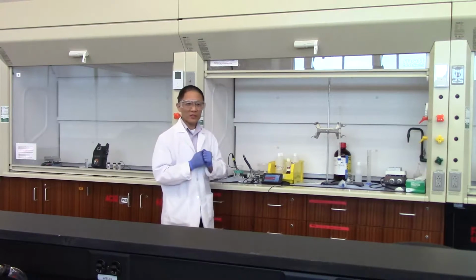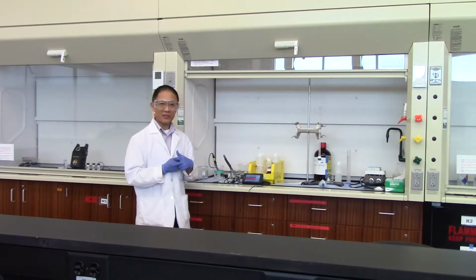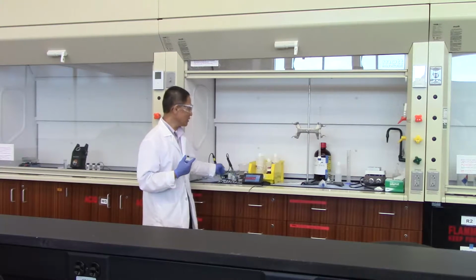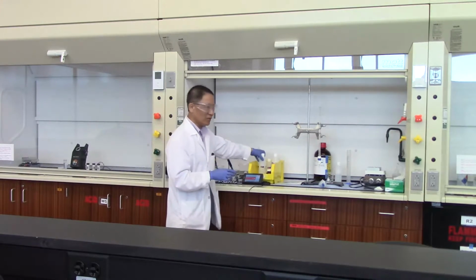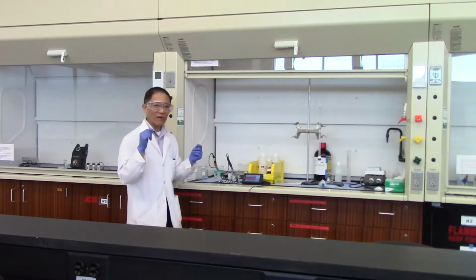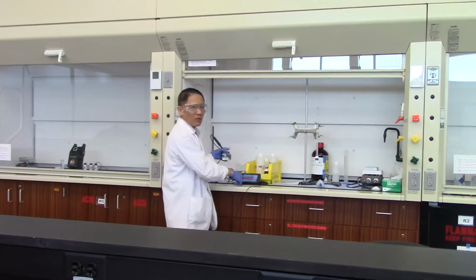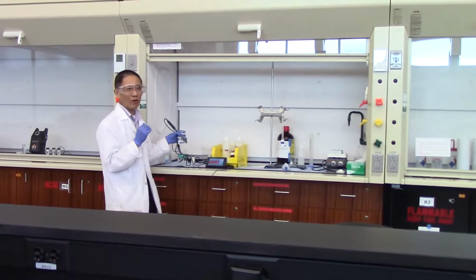So here in this experiment, we want to prepare two buffer solutions and we want to study the buffer capacity. So here in this beaker, I have the buffer A already prepared. I took 100 milliliter of the 0.5 moles per liter acetic acid, and I put it in a beaker. And then I put in 0.7294 gram of sodium acetate, and then mixed it together. And you can see the pH is being measured here, and the pH of the solution equals 4.05, a little bit over 4. Okay?